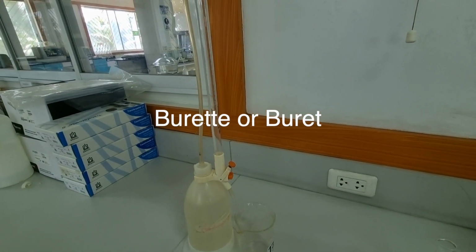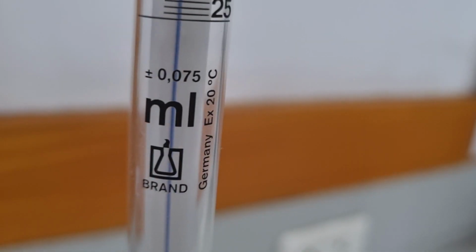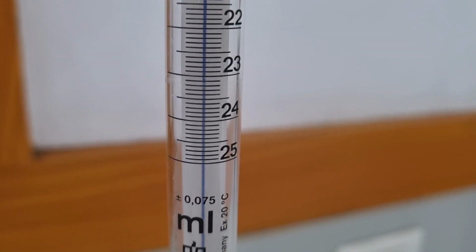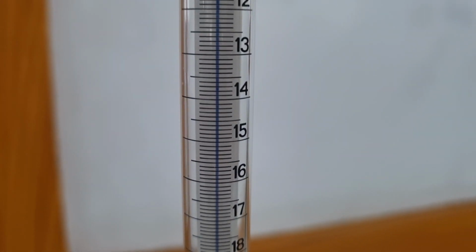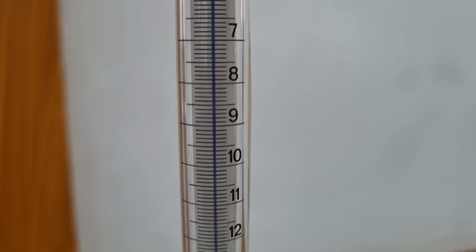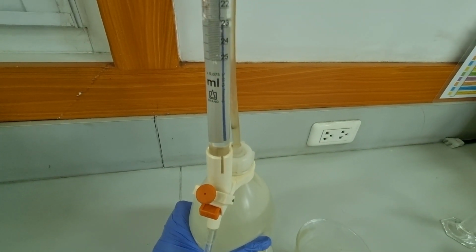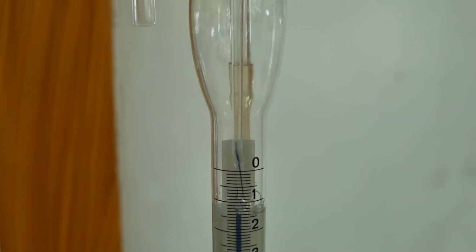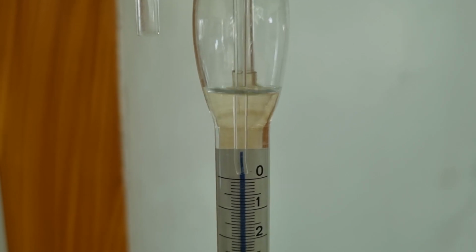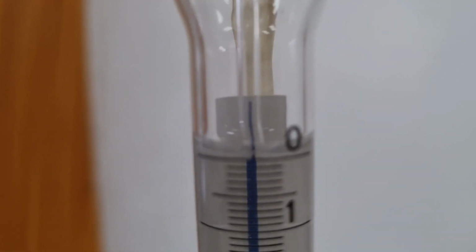This is the burette, which is the volumetric glassware I will use for delivering known amounts of volume. It is a TD instrument, and this particular burette has a capacity of 25 ml. I put my sodium hydroxide inside. This burette is one of those auto-fill burettes where you squeeze it to fill the container, and it is calibrated to auto-fill to 0. This makes sense for frequent routine analysis like in production lines. I personally do not like starting at 0, so I pass some solution through the burette first.